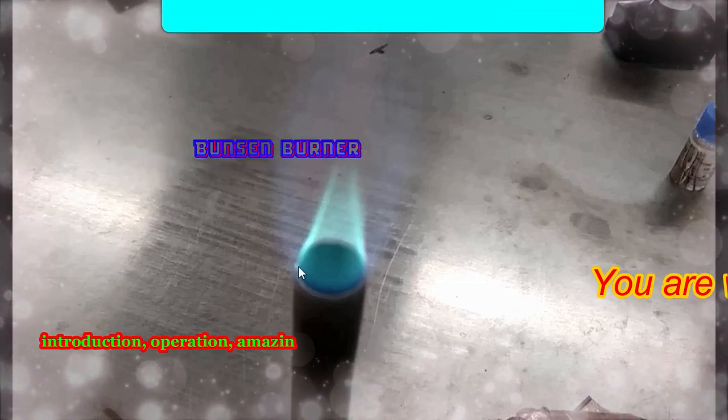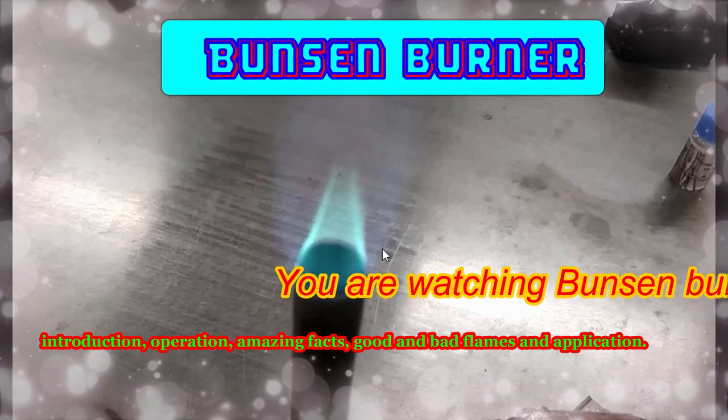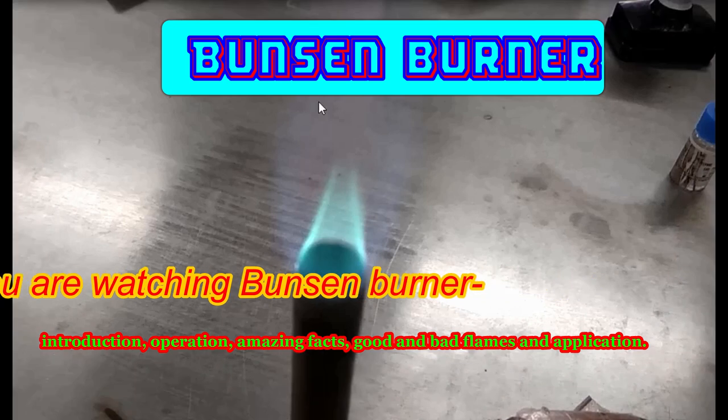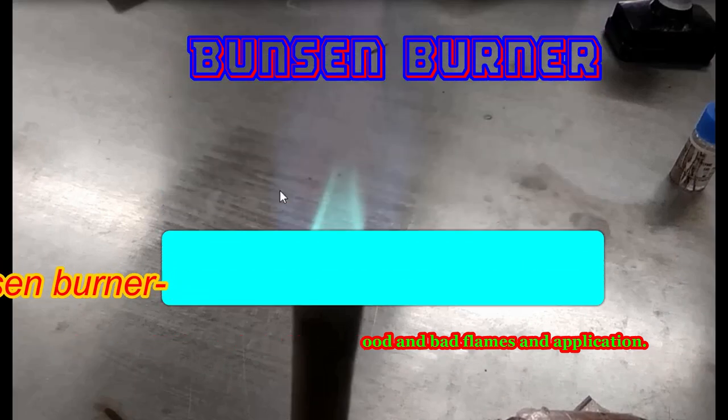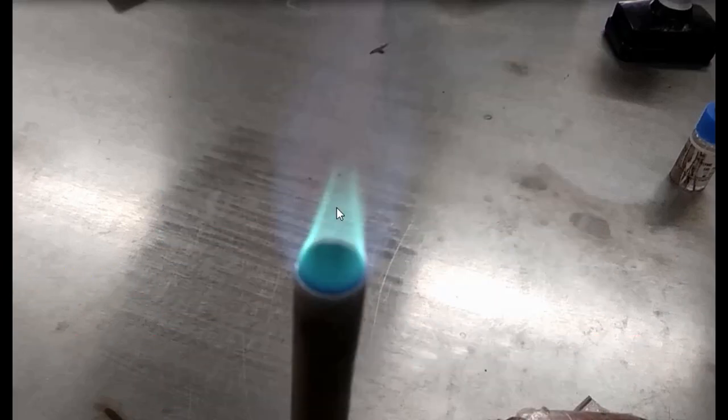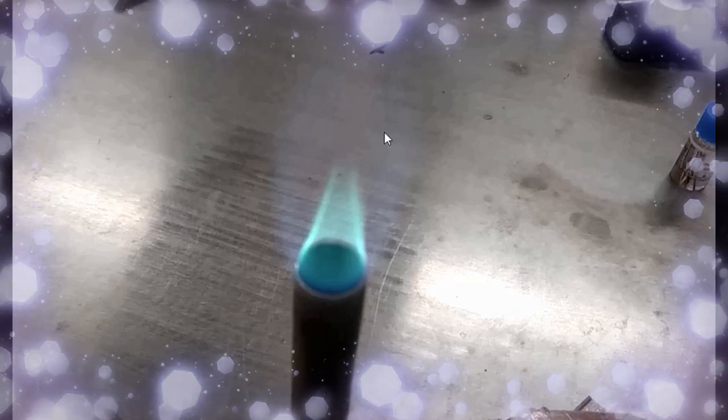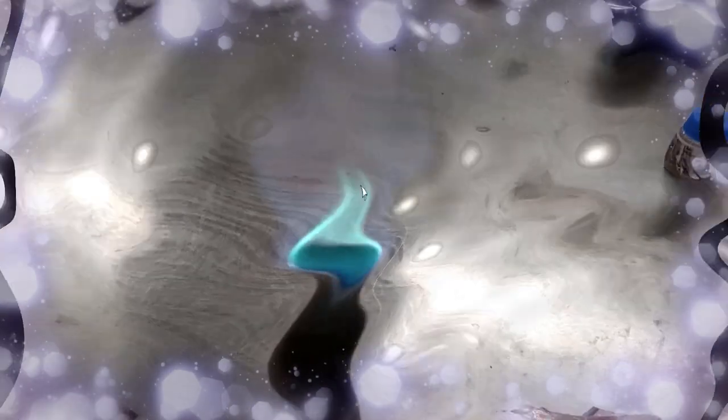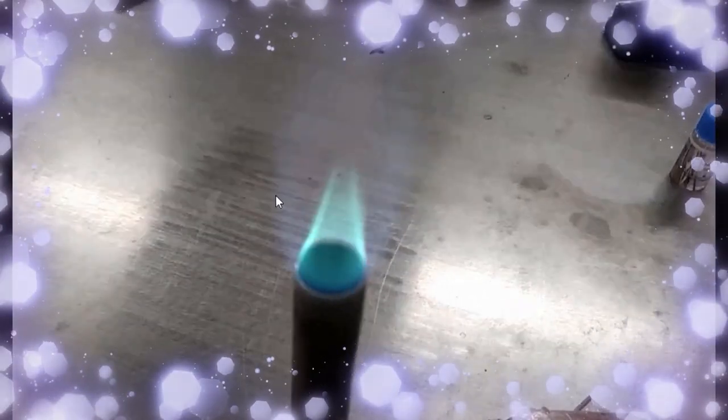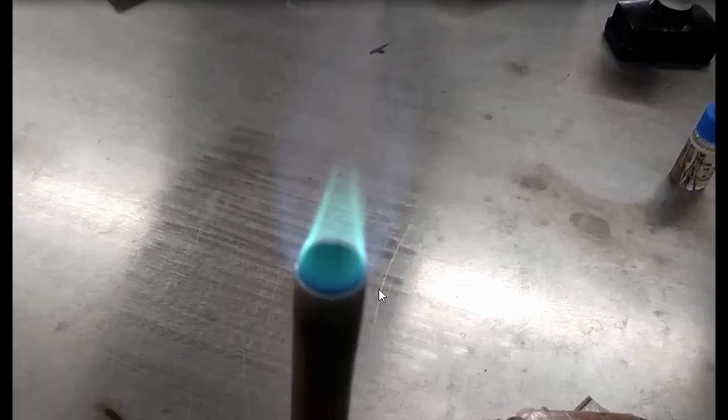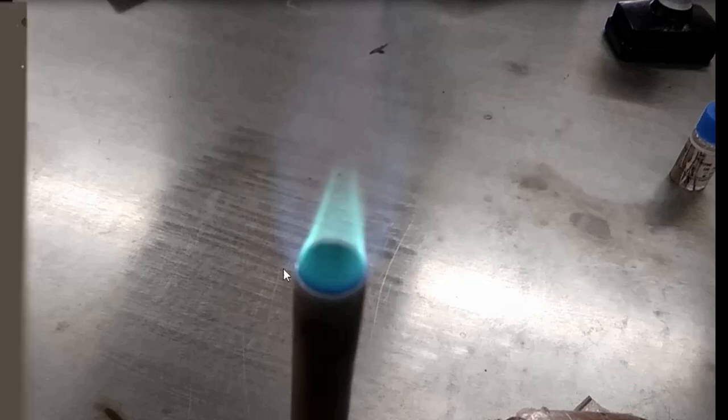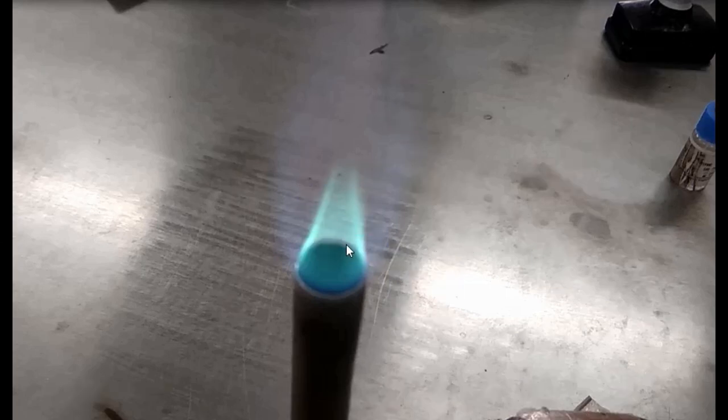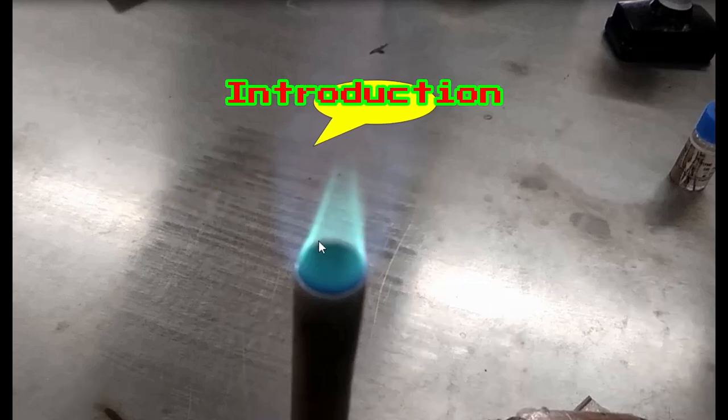Hello everyone, today we are concerned with Bunsen burner introduction, its parts, how to operate, amazing facts about it, how to identify good and bad flames, and on the way to ending, applications of the Bunsen burner. Enjoy this clip to the last. Okay, a Bunsen burner.